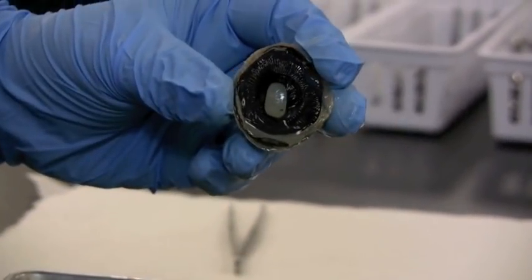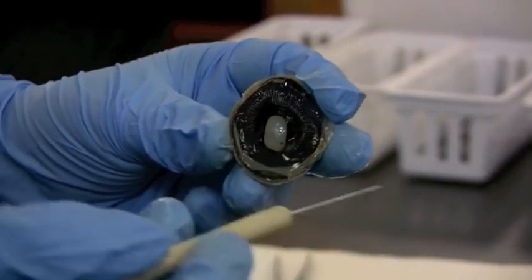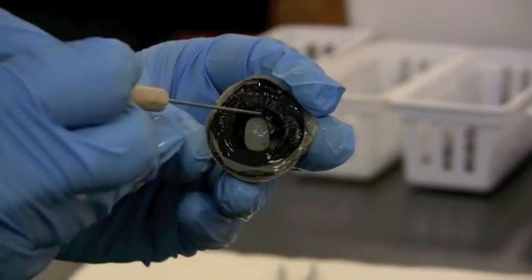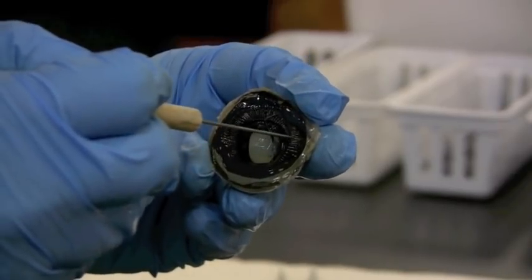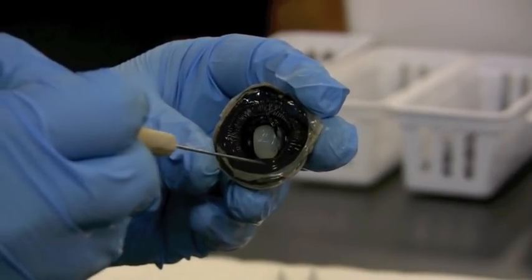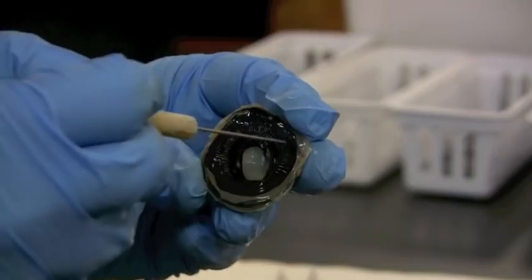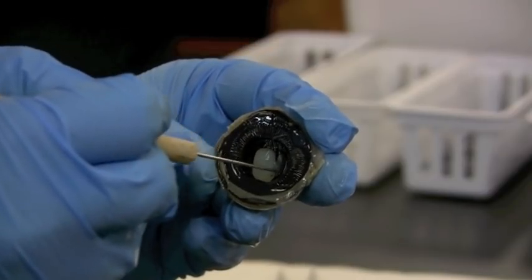So remember the iris is part of the choroid layer, that middle layer of the eye. So the iris is around here. The ciliary body that holds onto the lens is also in that area. And we've got these little serrated edges.